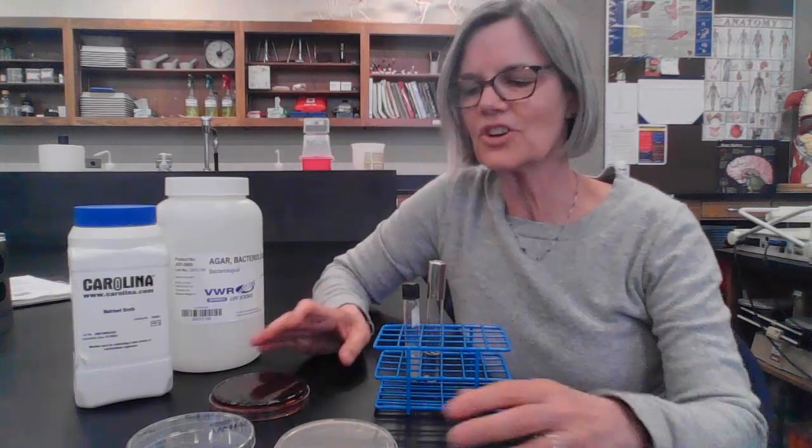Hi everyone, Brenda Gustin here, and I wanted to show you a little bit about the media that we use for growing bacteria and fungi in the microbiology lab.